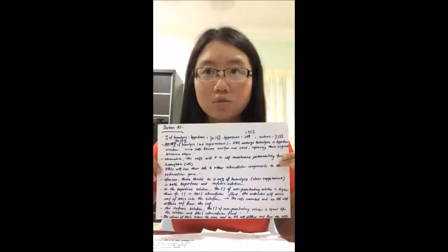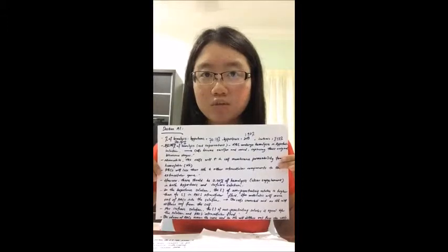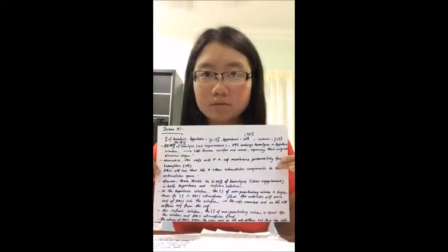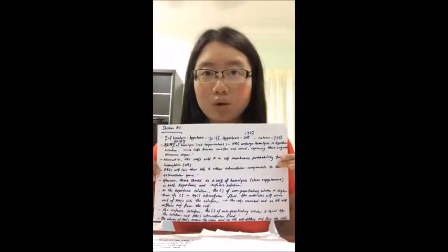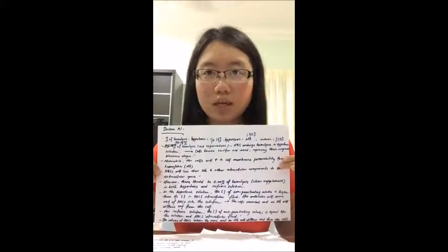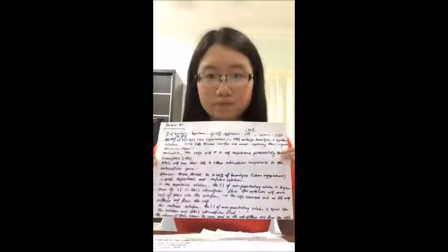hypotonic solutions. When the red blood cells are placed in hypotonic solutions, the cells become swollen and round, replacing their original biconcave shapes. This is because the concentration of non-penetrating solutes in hypotonic solutions is much less compared to the red blood cells' intracellular fluid. There is a net flux of water, thus the water molecules will move down their concentration gradients into the cells. Meanwhile, the cells will increase in cell membrane permeability towards the hemoglobin. The red blood cells will lose their hemoglobin and other intracellular components to the extracellular space.